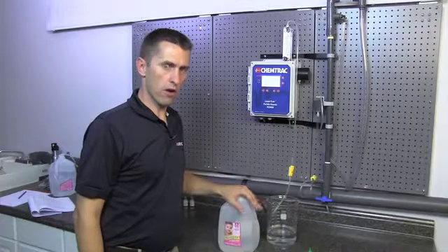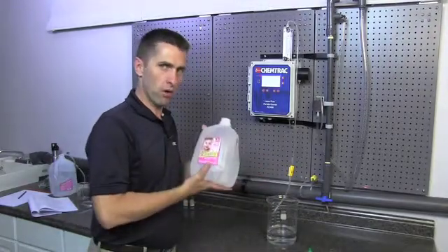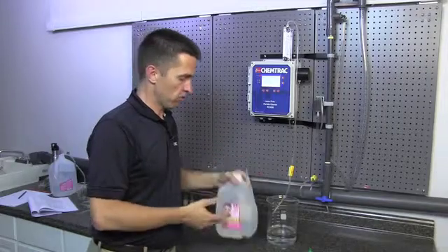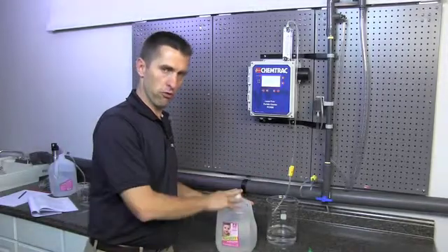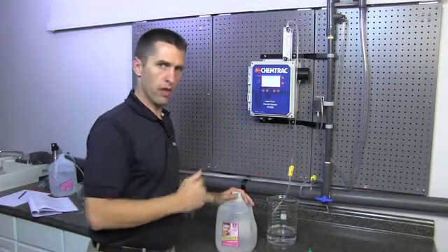Now we're ready to do our 5 micron calibration. Just like with the 2 micron calibration, we're going to check the blank water counts first. And then once we do that, we're going to prepare a new set of tubing just for this jug, and then plumb it all back up.